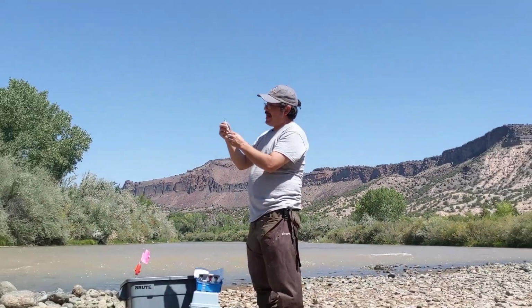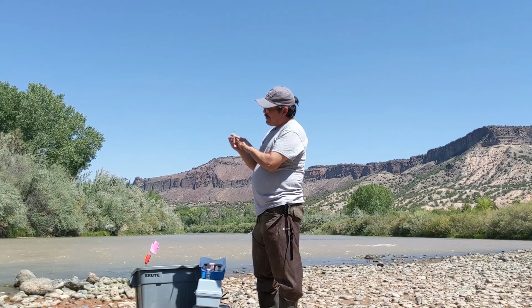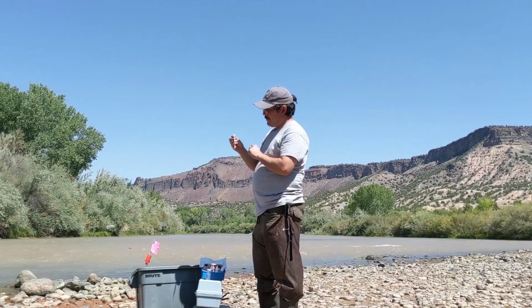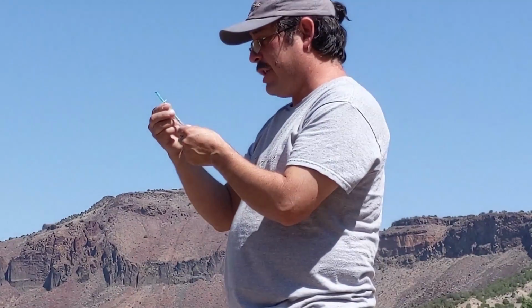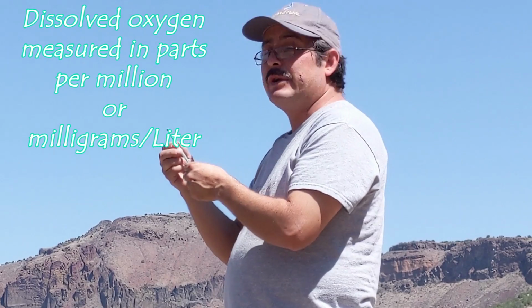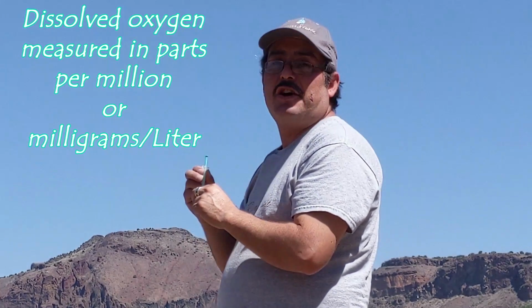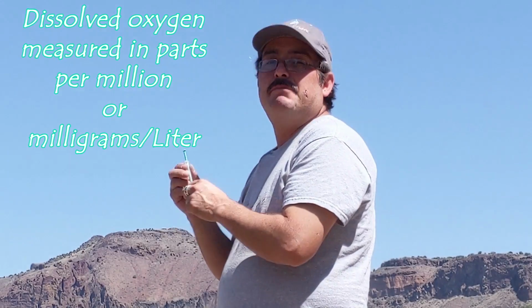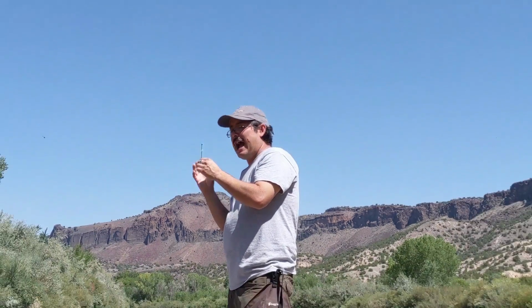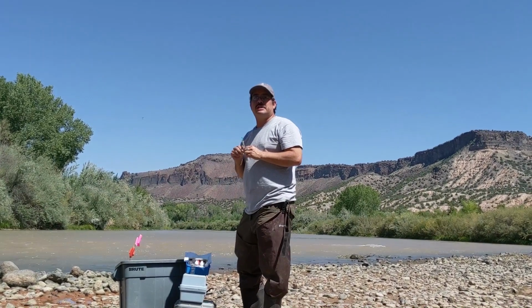Okay, so we can now get our value for dissolved oxygen by reading this titrator here. Okay, it looks like our reading is a 6.8, but again, we need to consider the units. The unit of measurement for dissolved oxygen is milligrams per liter. If we have a liter of water, how many milligrams of dissolved oxygen are present within that liter?